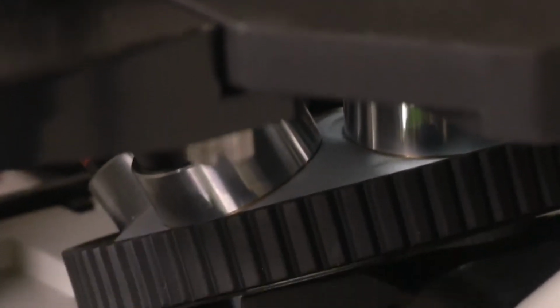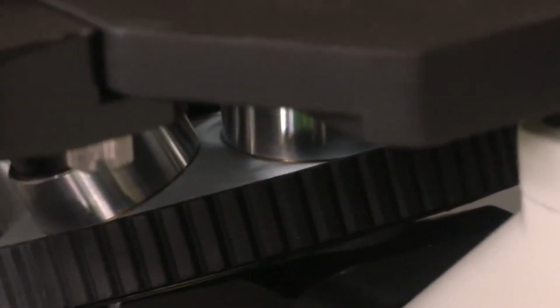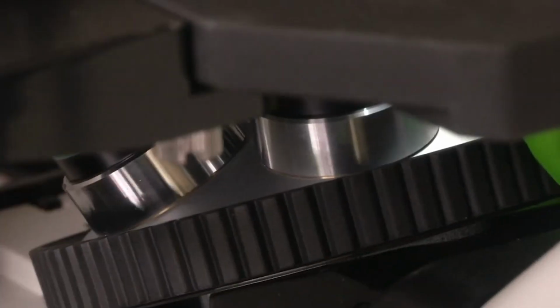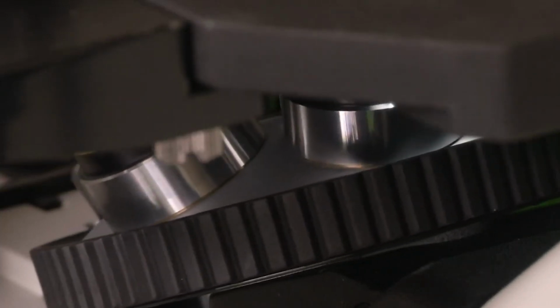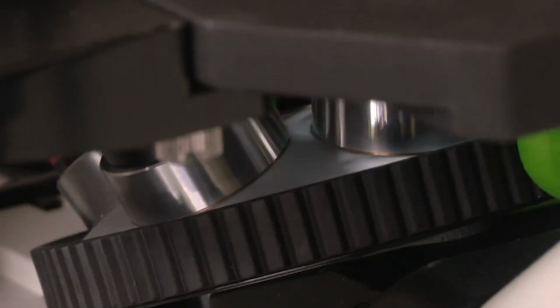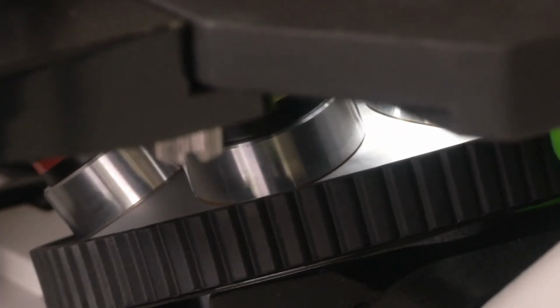So, here you see this is the turret. It has different objective lenses. If you remember correctly, I had run you through the different color codes that are there for objectives. You might not be able to see the print, but you might be able to see the color, the yellow color there. I think now you will be able to see the turret moving very clearly with the different objective lenses coming into focus. As and when each objective comes into focus, you will hear a click sound.